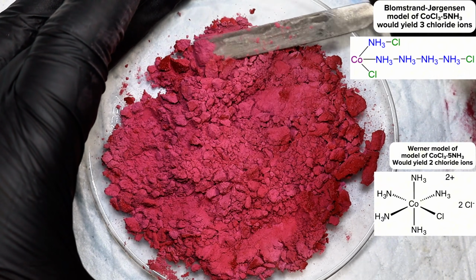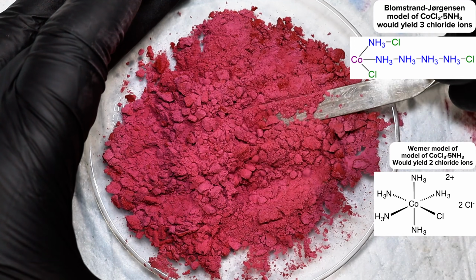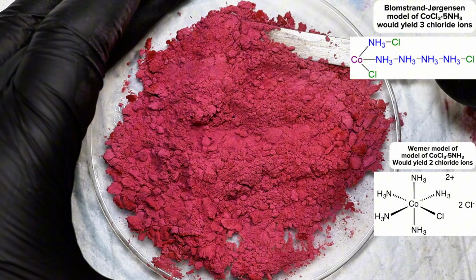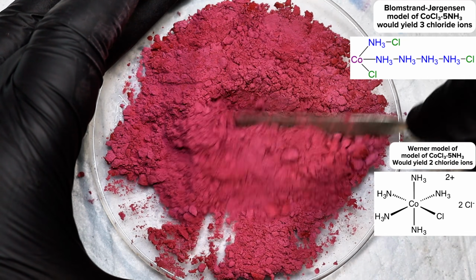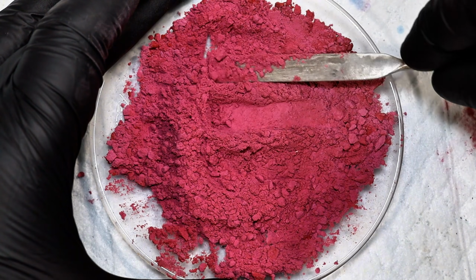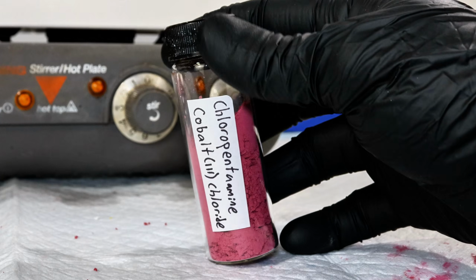By reacting aqueous chloropentaamine cobalt chloride with excess silver nitrate, only 2 equivalents of silver chloride would precipitate, which showed that the third chloride was indeed directly bound to the metal center and therefore highly resistant to substitution. This discovery, along with further experimentation with chloroamine cobalt complexes, was the basis of Werner's Nobel Prize-winning model of metal complexes, and to this day it's the model we still use.